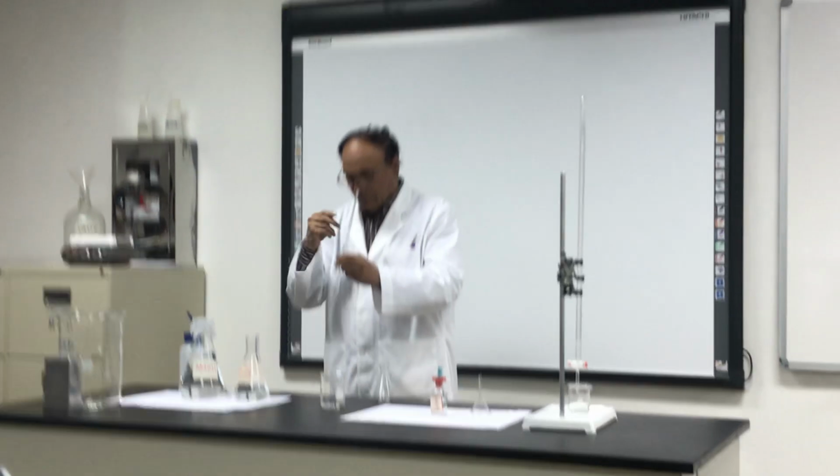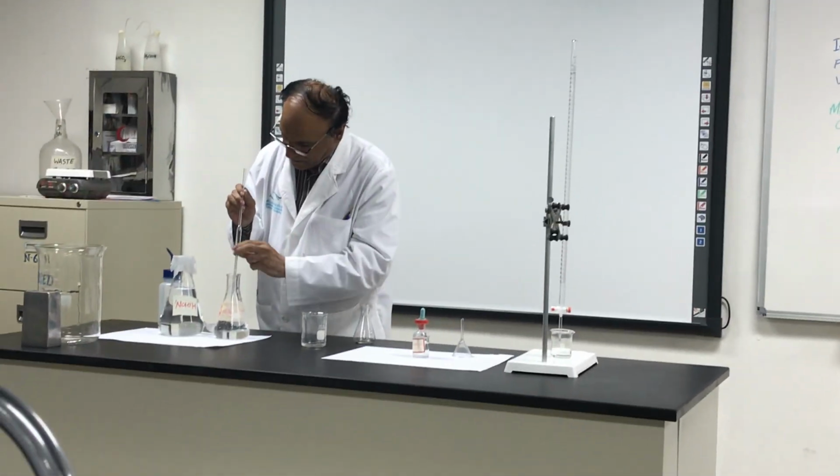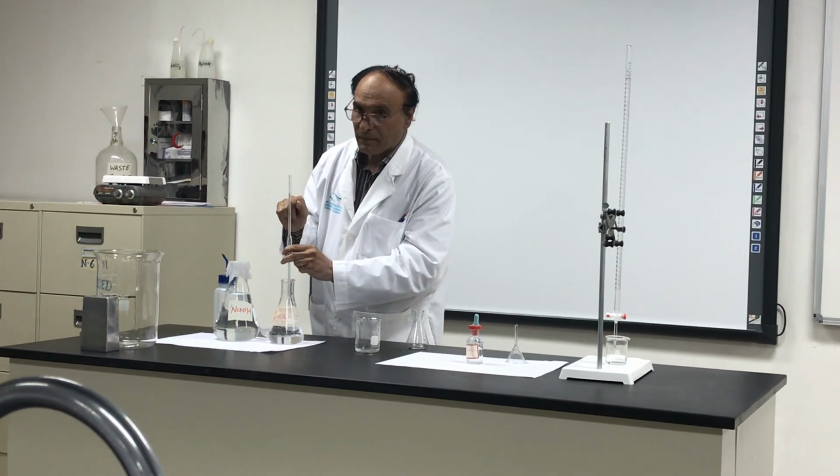Now, when it is washed, you take it and bring it above the mark.